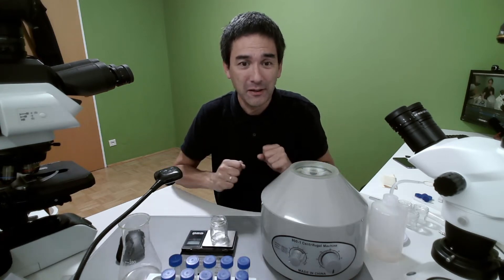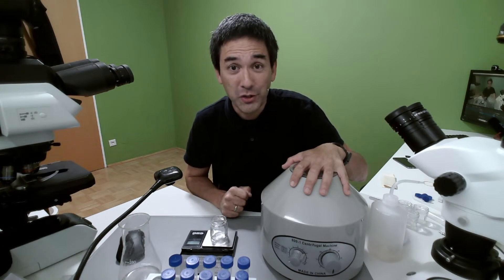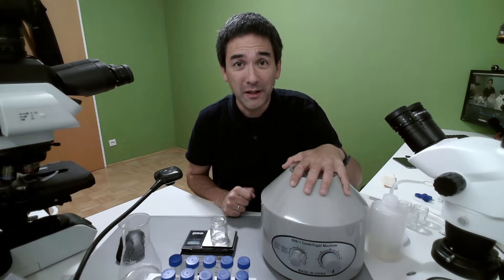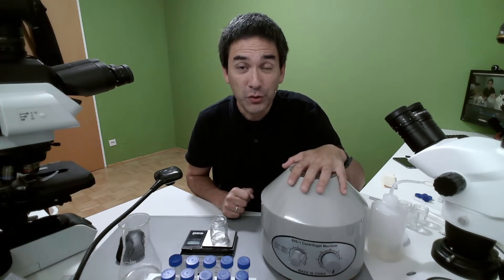I've also put a centrifuge here on my table, and today I would like to show you how to use the centrifuge.